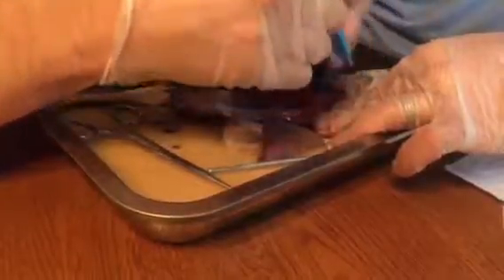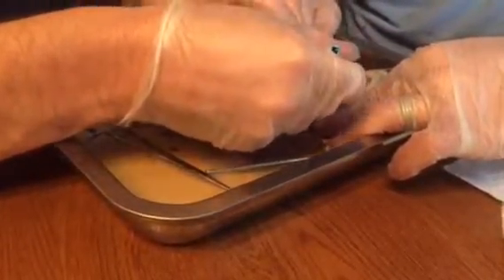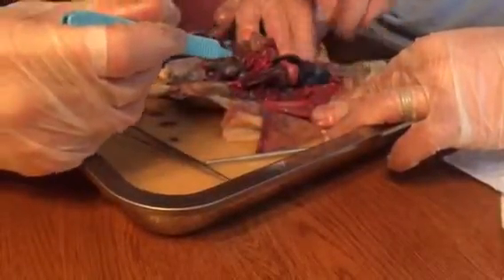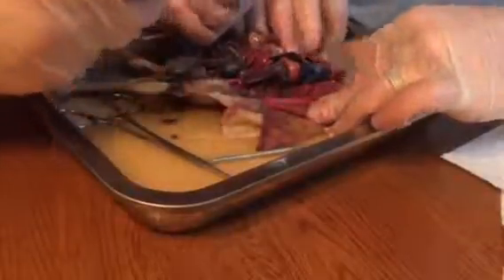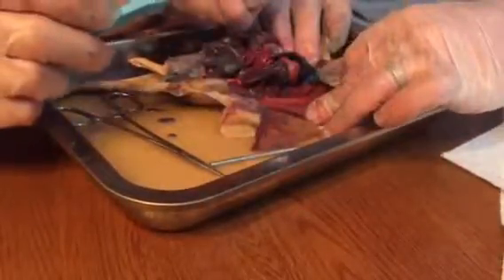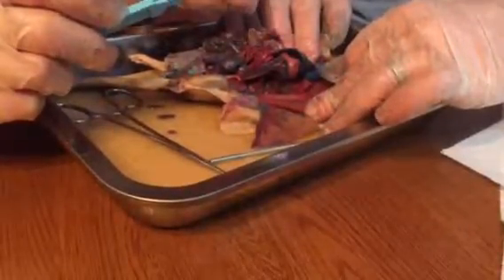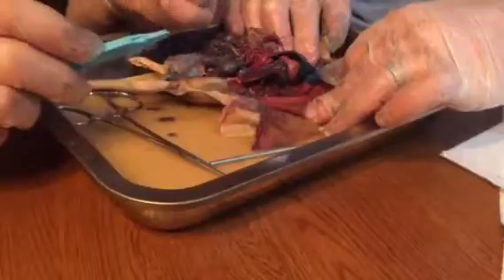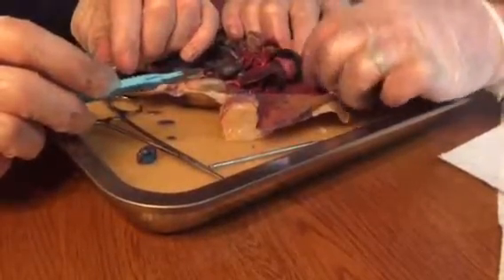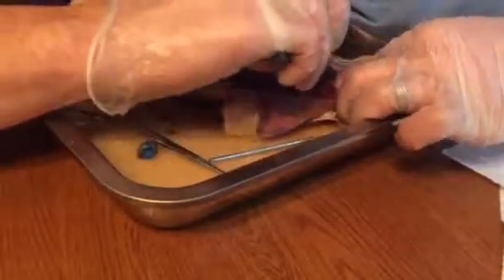It's all very blue and red, though. It's all dyed into nonsense back there. You can't really see much of it. It just kind of fuses together. All the atriums blew up when they filled the dye up. They blew up. It just kind of exploded. There's pieces, that's why this is all blue. It all leaked out onto that guy. So they got a little overzealous with their pressures.